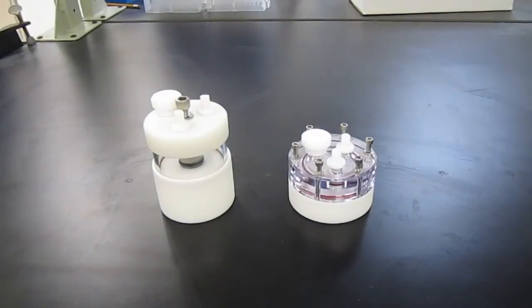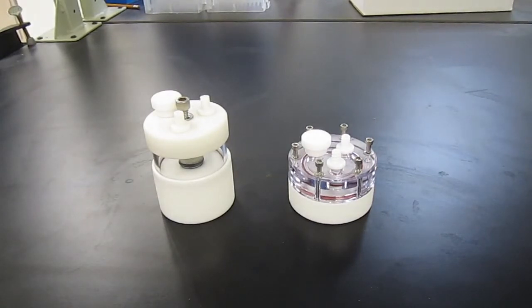Before use, the vessels should be washed in laboratory detergent and thoroughly rinsed.